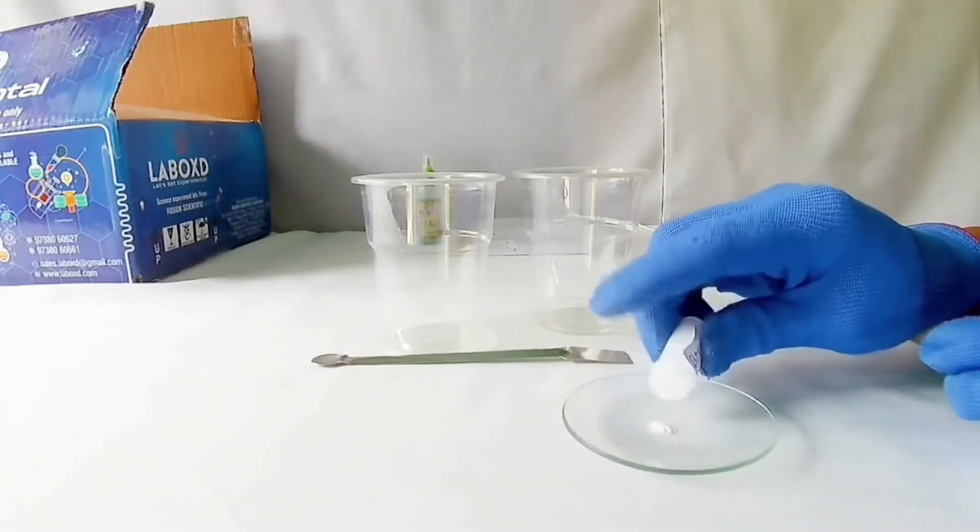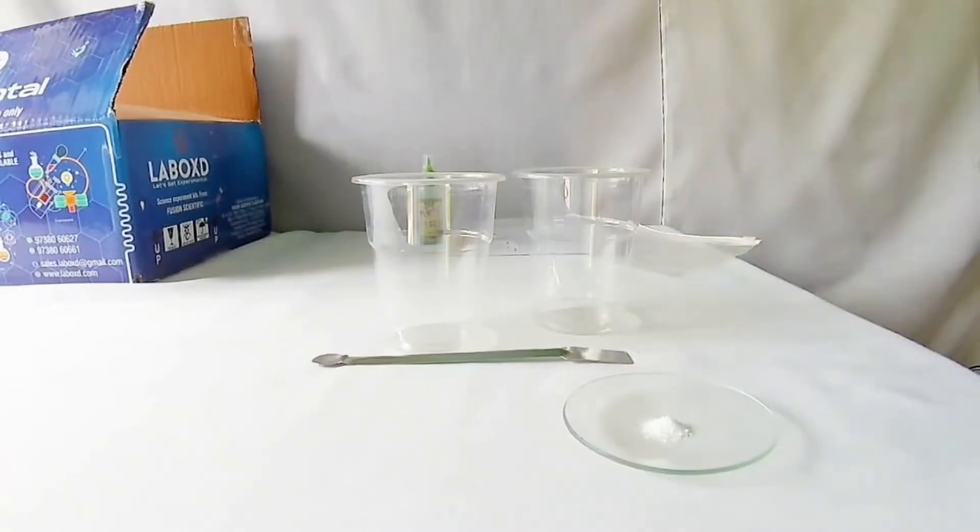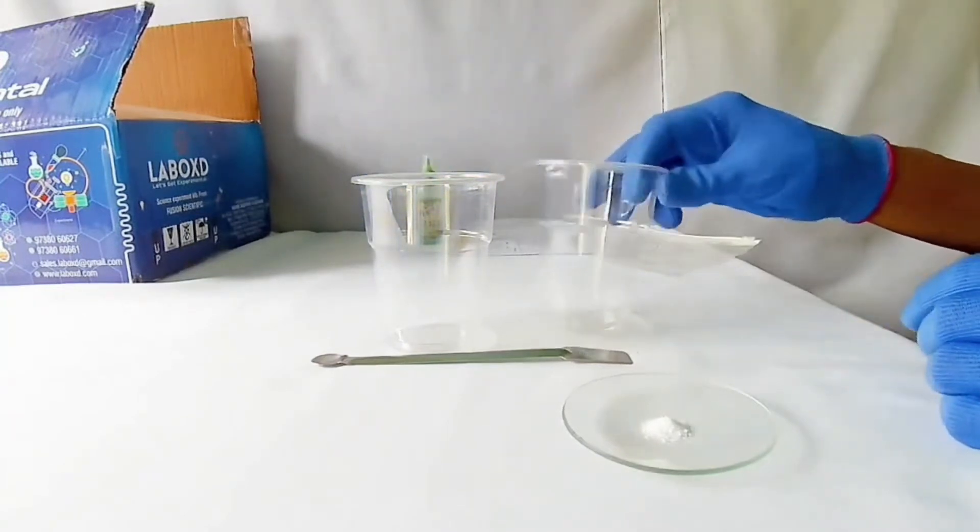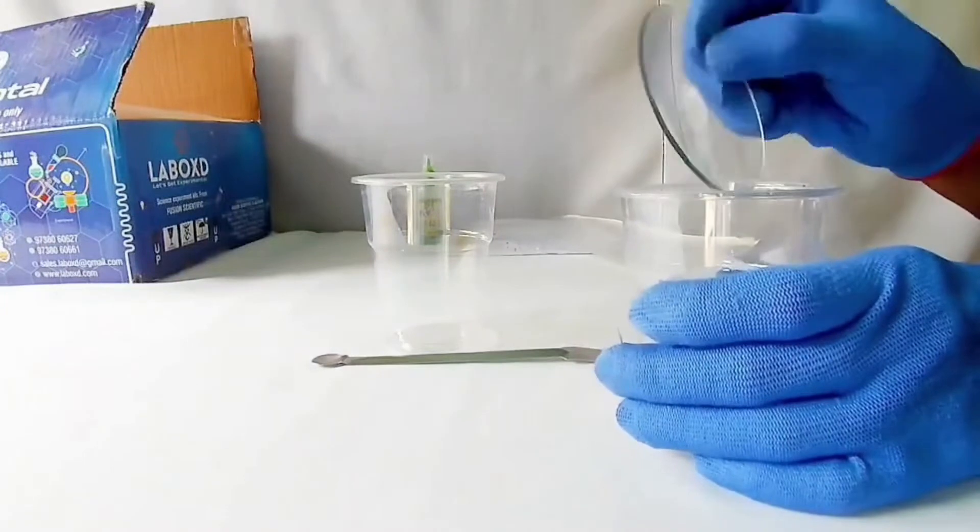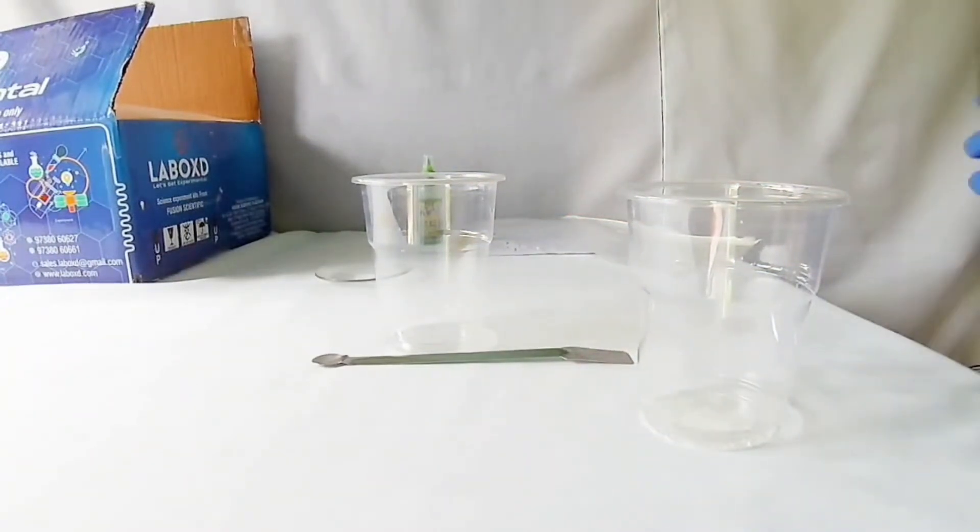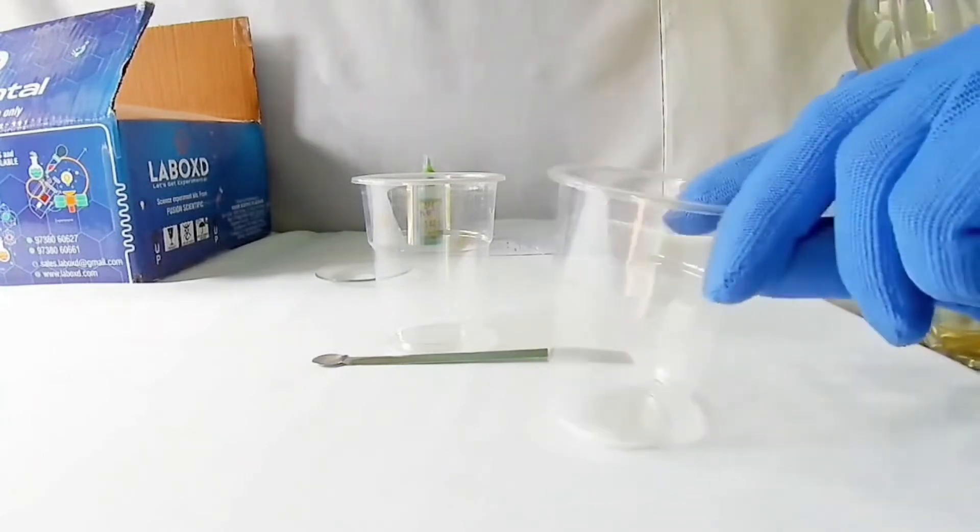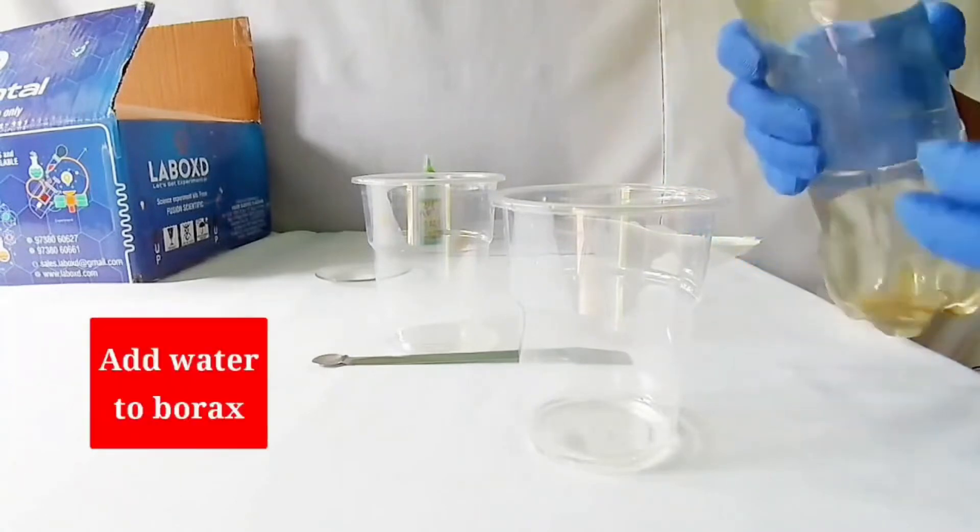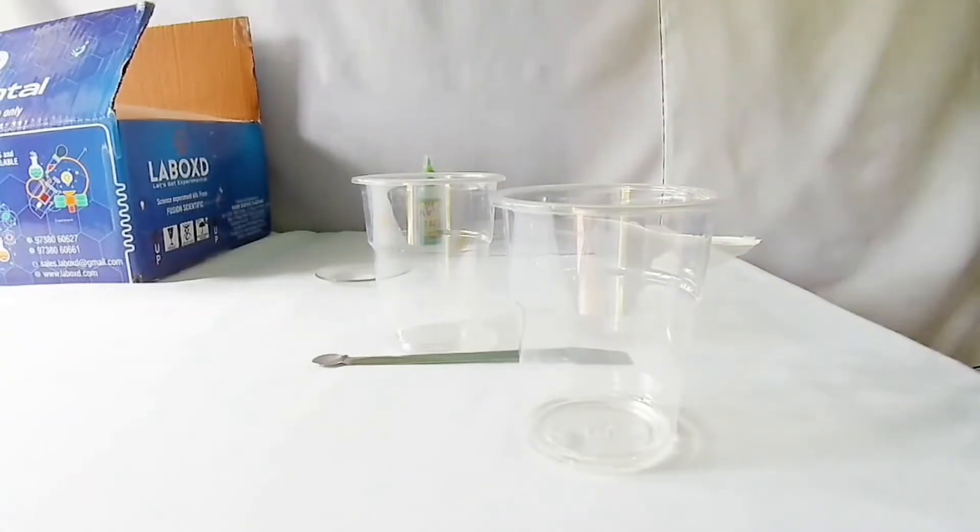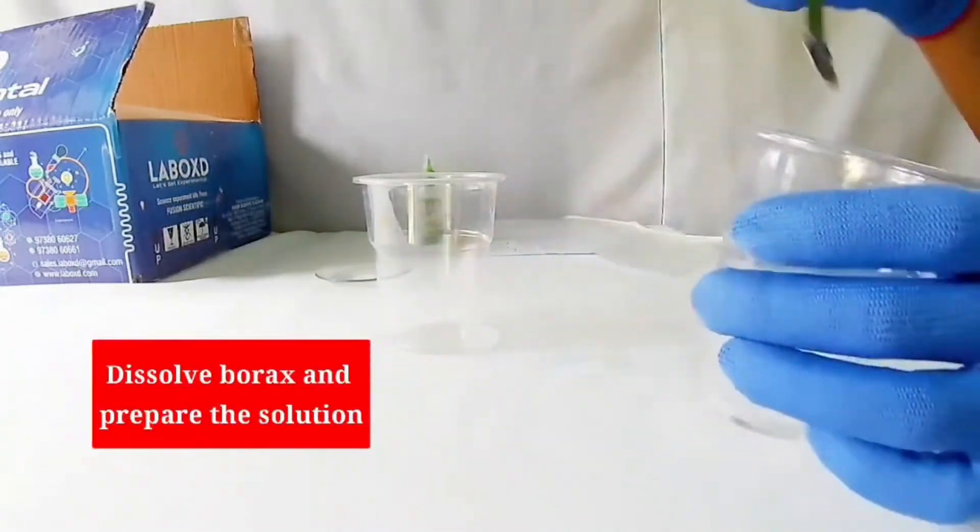Take some borax powder on a watch glass. Add this to one transparent glass. Add a little water to the borax powder in the glass. Mix it well and prepare the solution.